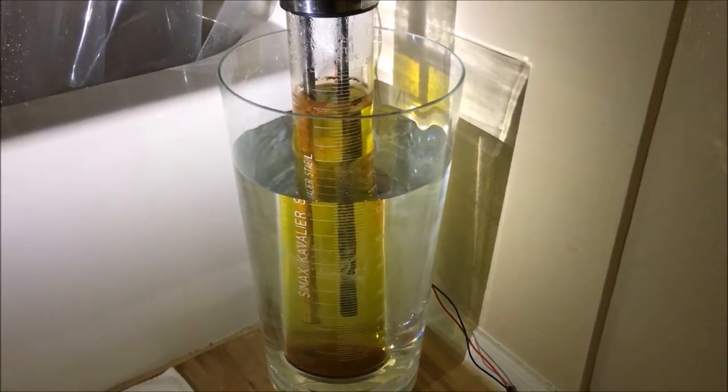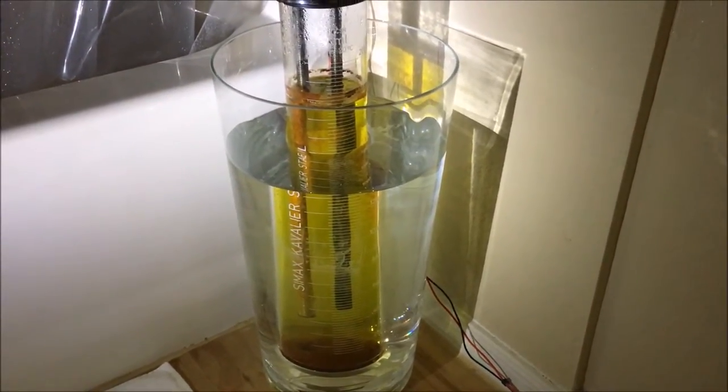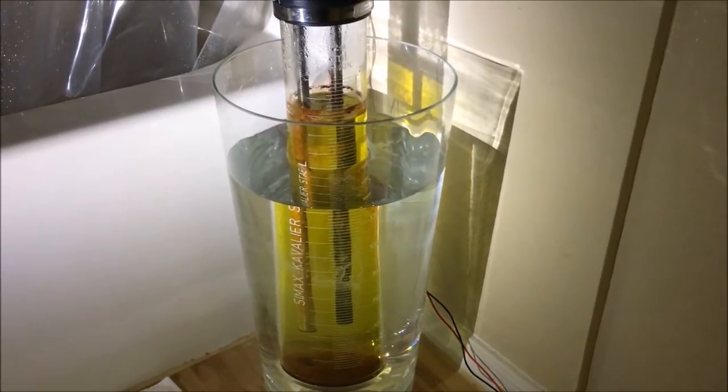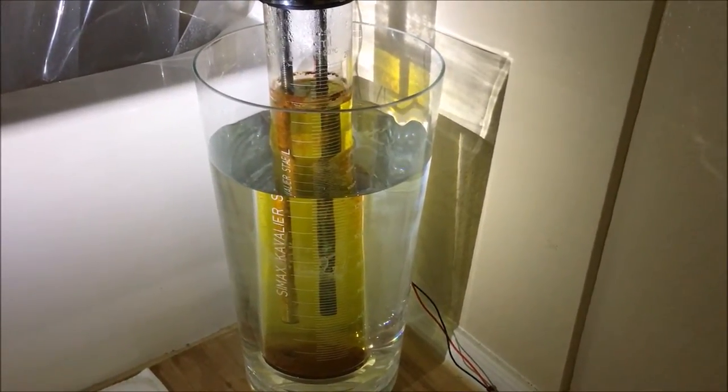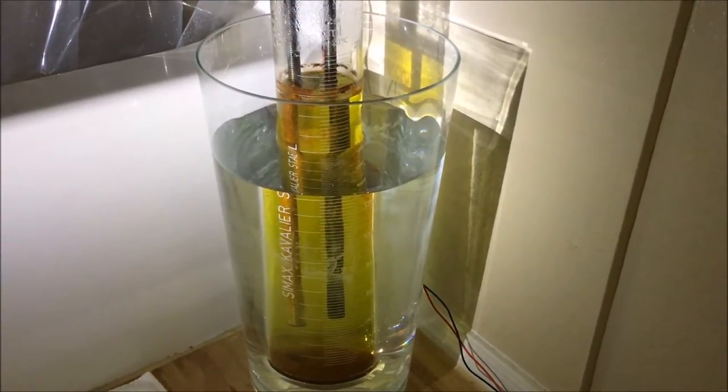Now, I supplied this system with 12 volts because I needed to get the current quite high in order to produce the amount of gas I wanted to. If I wanted to do it properly, however, I would have to keep the current per plate area extremely low and just have much, much more plate area.